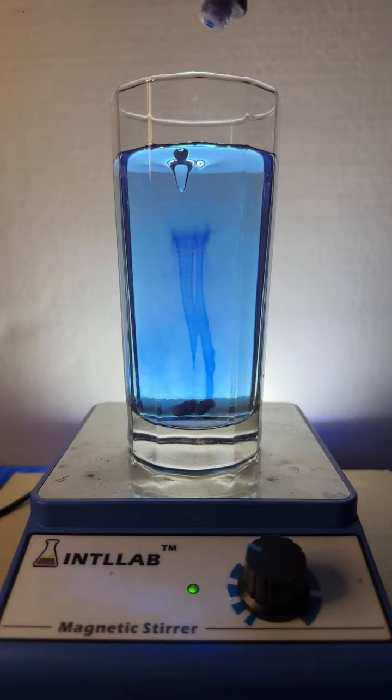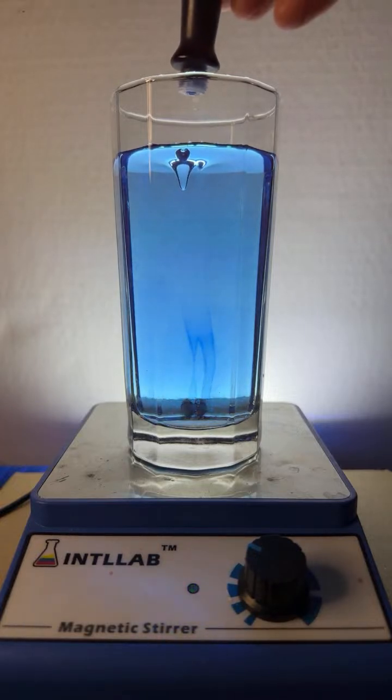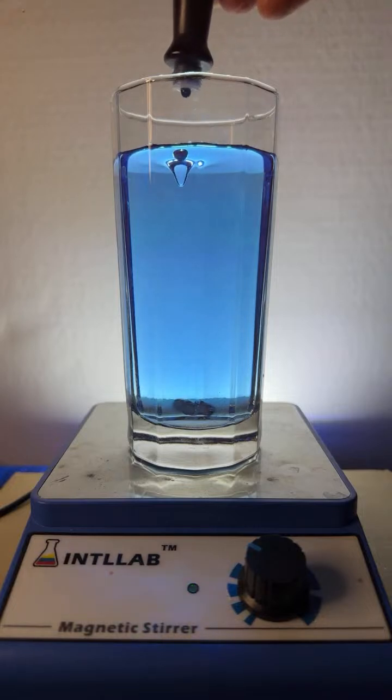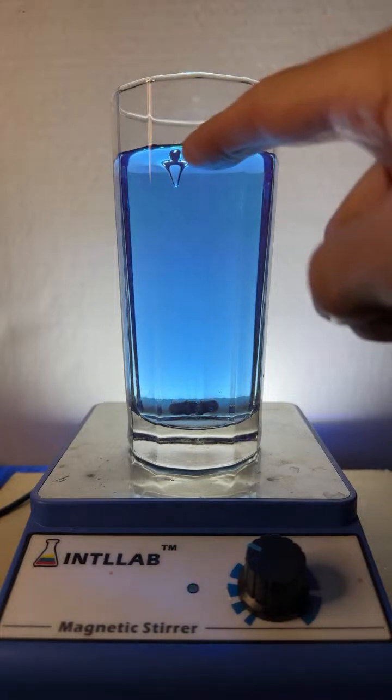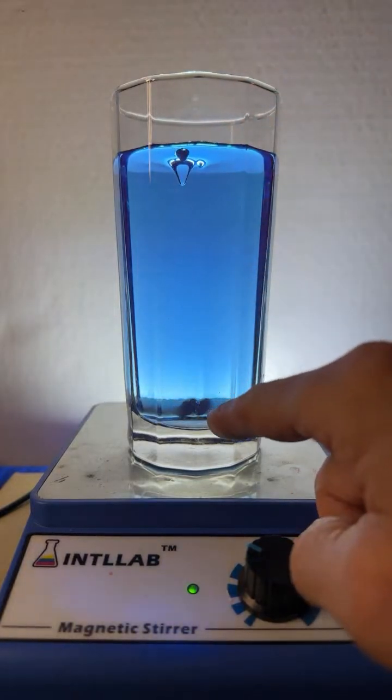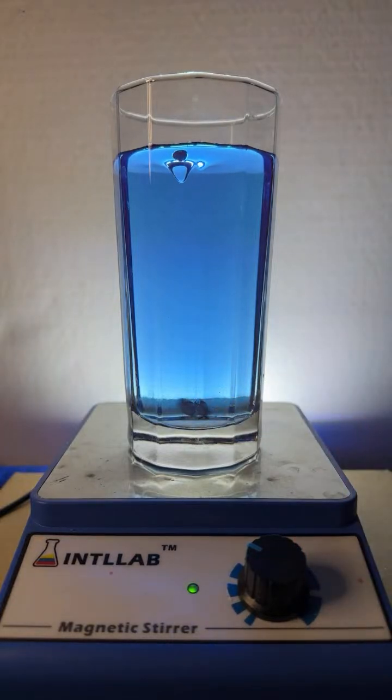Gosh, that's interesting. So yeah, people have studied flow patterns in. Thanks, Tracy. I appreciate that. People have studied the flow patterns in these stir bars, and they do indeed show that there does tend to be a stable flow that runs from the vortex down to the stir bar. Add another drop. All right, let's see what happens when we start adding some acid and base.